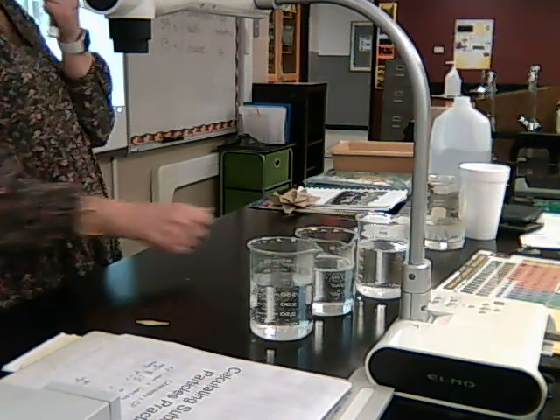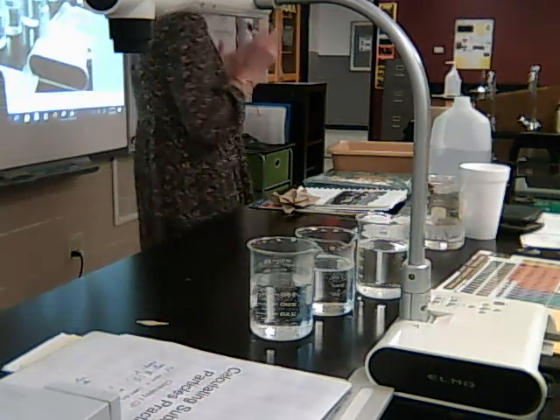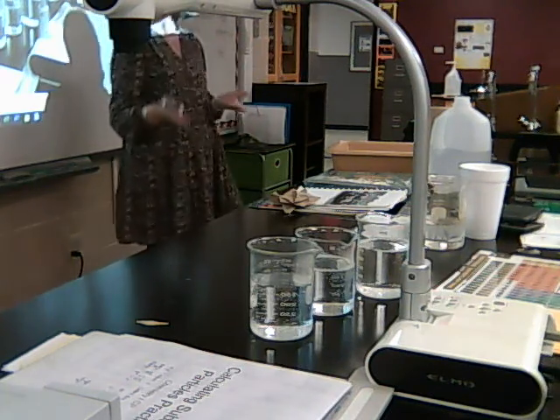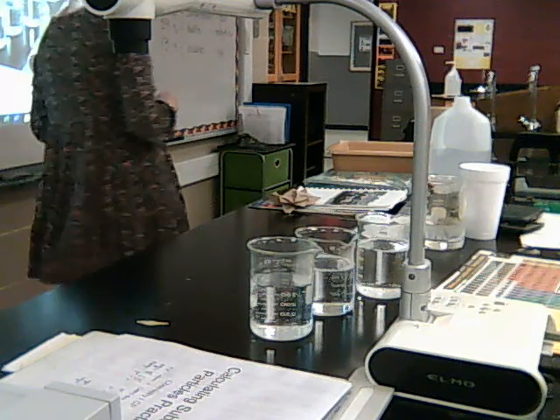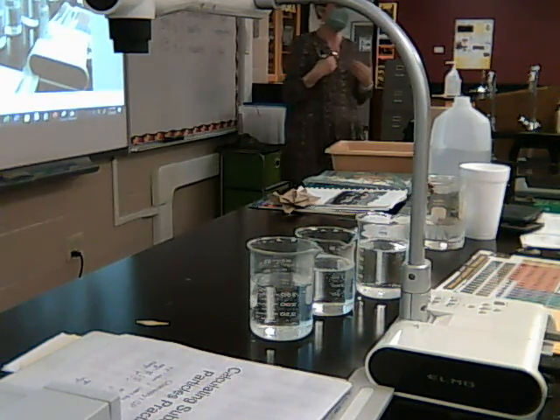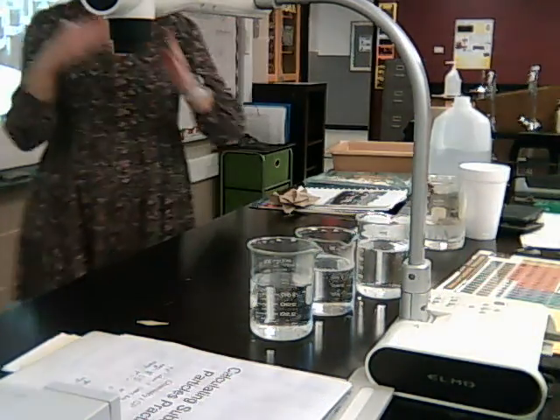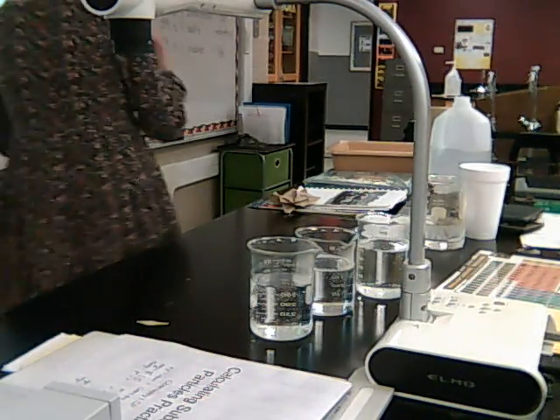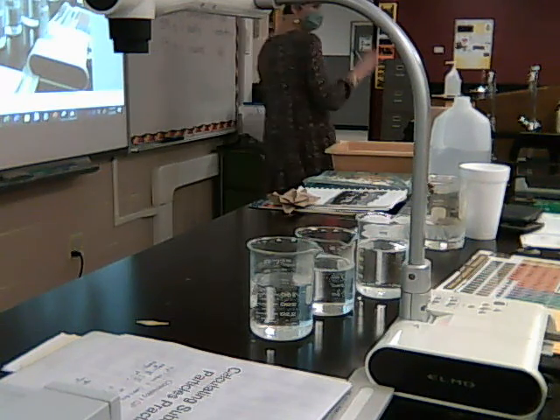I didn't measure the tablets. All I did was cut them. How fast it disappeared, which is the rate. Okay, so I was measuring the rate of the reaction or the time that it took the reaction to happen. Okay? And that's good, because that's what I wanted to know. I wanted to know, how does the surface area affect the rate of the reaction? So I'm going to change the surface area. I'm going to measure the rate by measuring the time. I'm going to leave everything else the same.